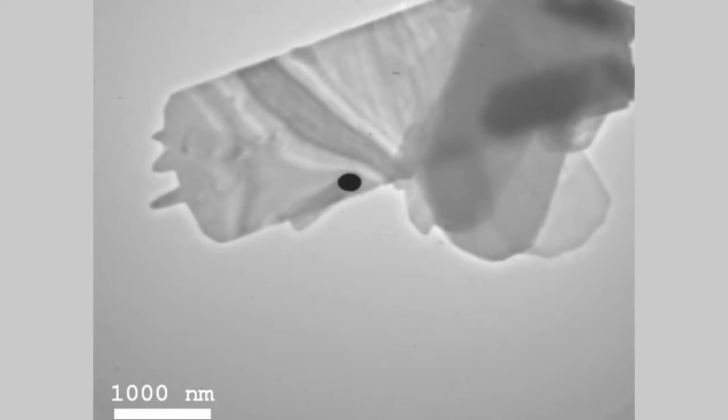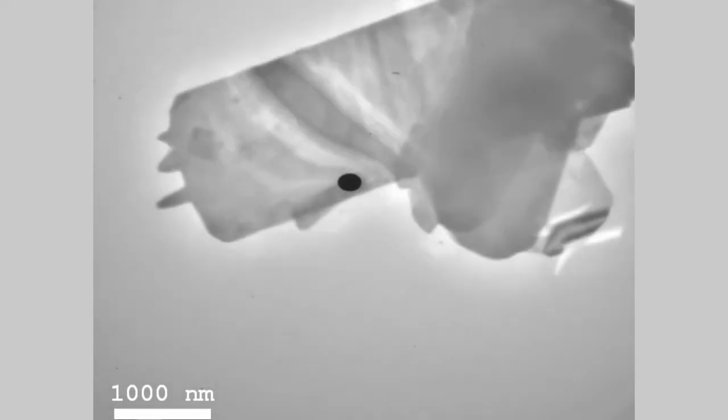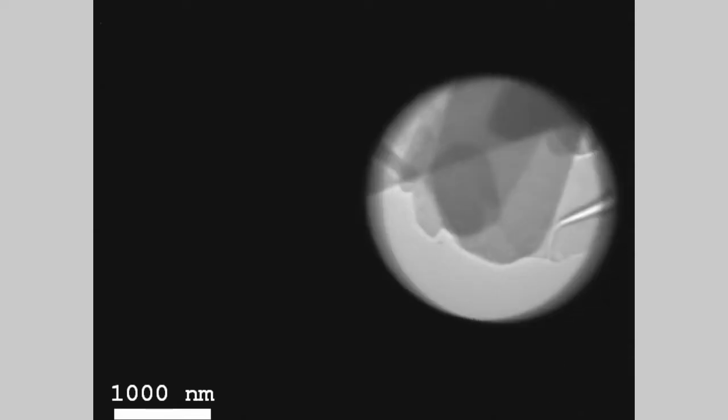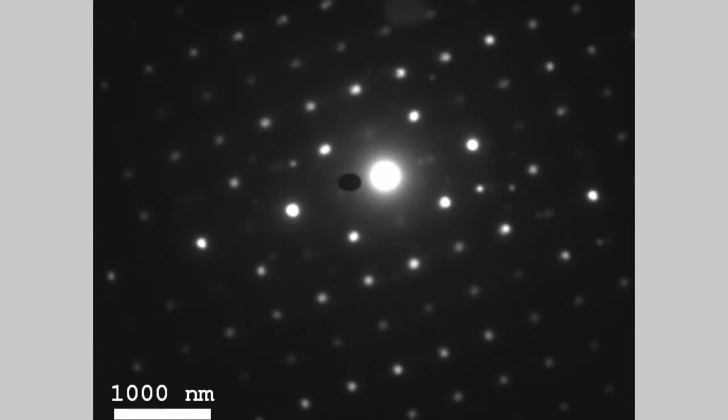Now watch what happens when I turn the focusing knob. If we want to make electron diffraction out of this, then we use the selected area aperture. And then we select the region of interest. Go to diffraction mode, and you see the diffraction pattern. And molybdenum trioxide is almost simple cubic in its structure. So we suspect to see some kind of square-shaped pattern, as we can see in this image.